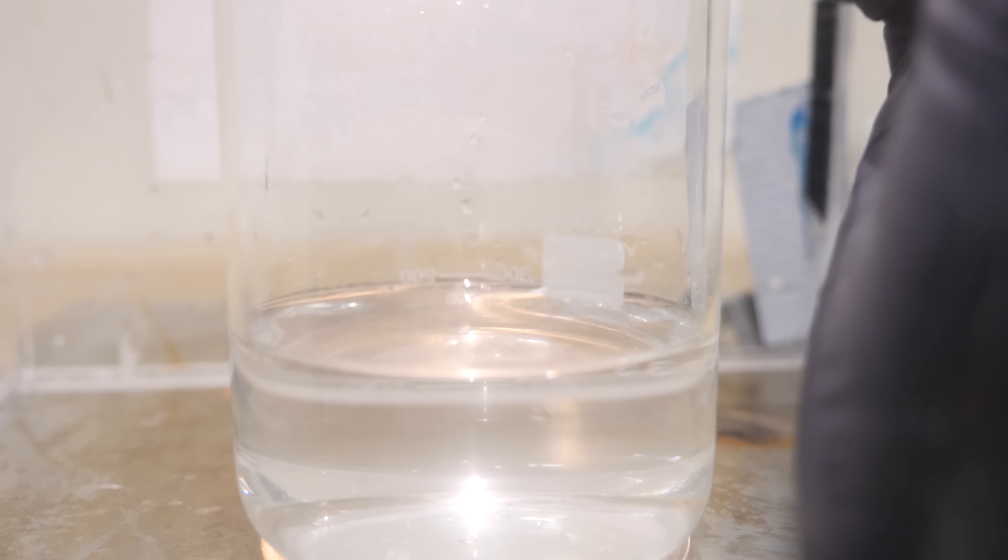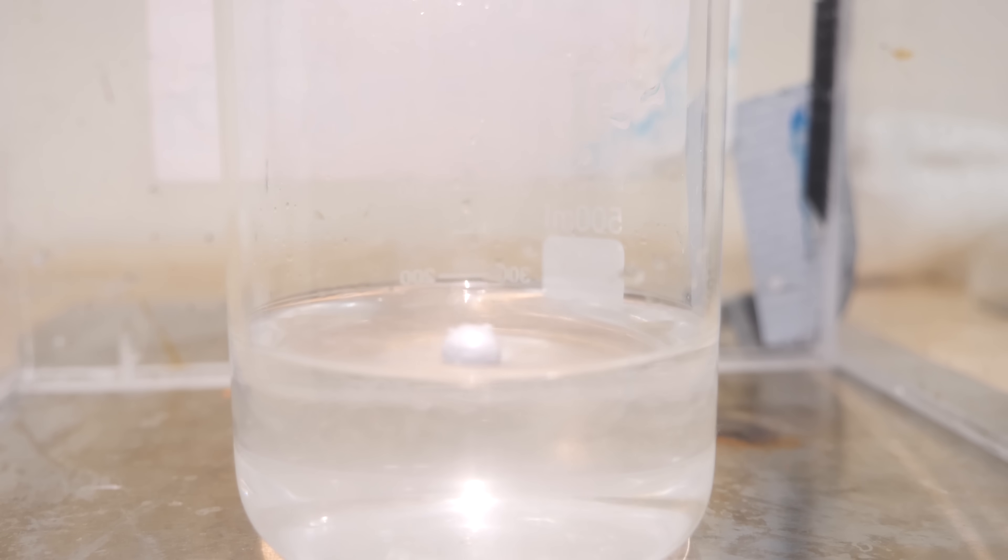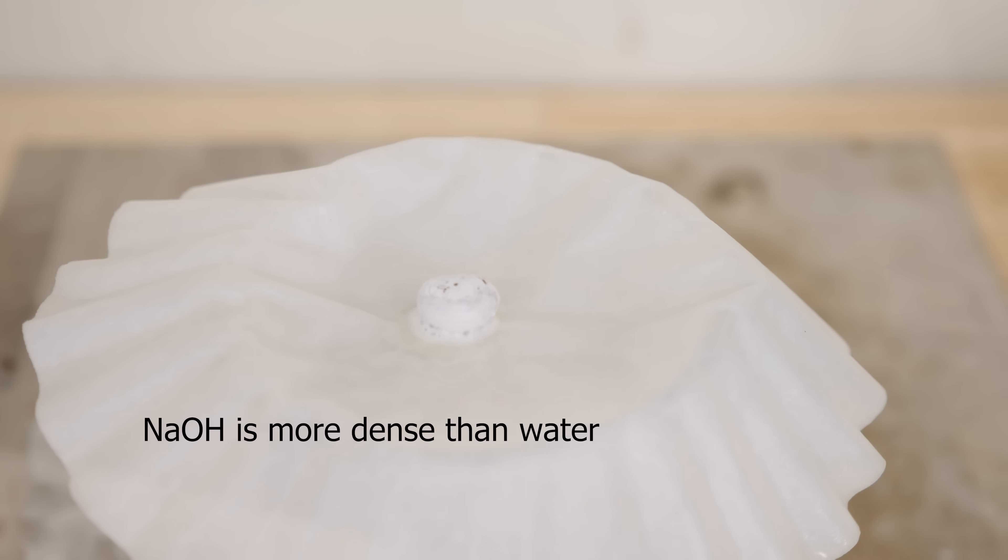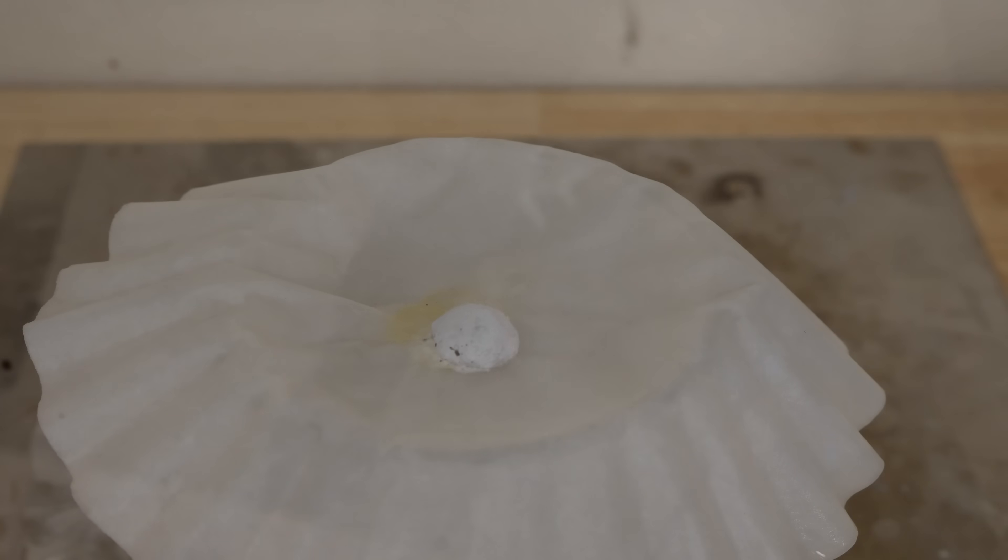Now one thing to be aware of in this reaction is normally sodium metal is lighter than water, so it floats on top. But in this case, even if you put the filter paper on top, once the transfer is complete and it's completely sodium hydroxide, it can melt down through that paper. So it burns down through the paper and drops down below into the water. So the coulomb explosion that happens once it's down in the water is a lot bigger.